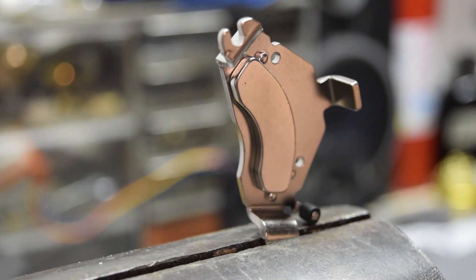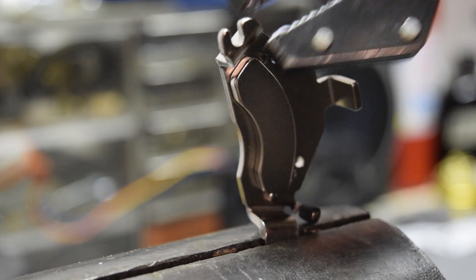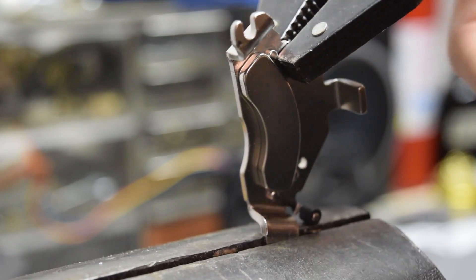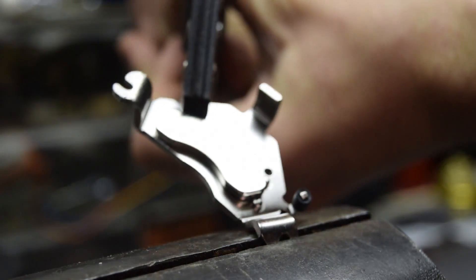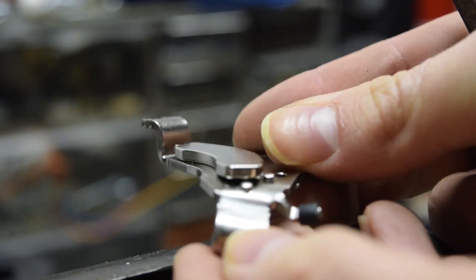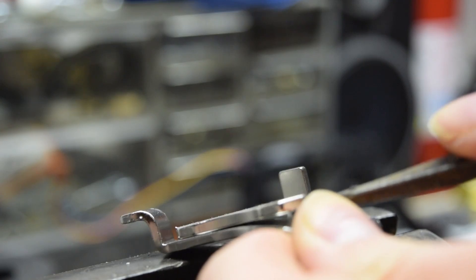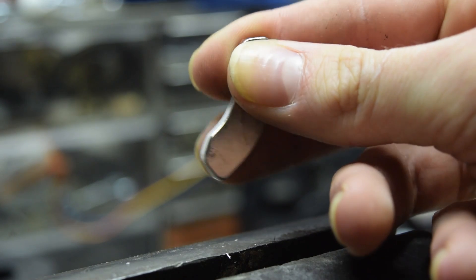Since the magnet is on a metal bracket that's going to have to be removed. To do that I'm going to put the magnet in a vise and grab the bracket with vise grips and attempt to bend it. I've made a little bit of room underneath the magnet so now I can stick a screwdriver underneath there and pull it off. With this magnet, be careful not to let it fly near any other metallic objects or it will shatter.